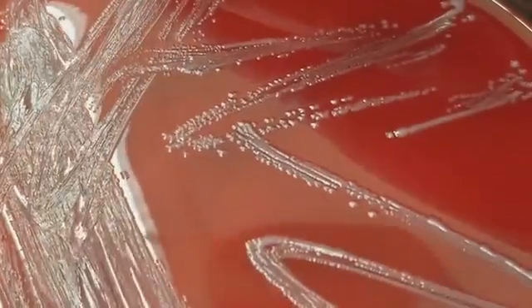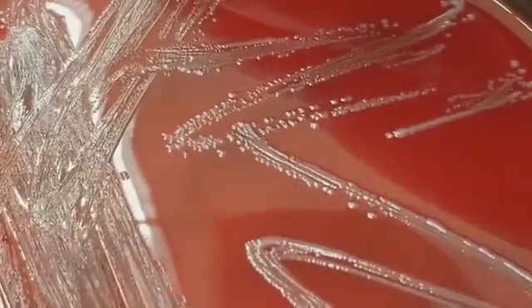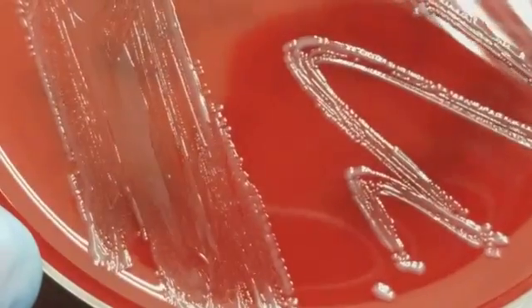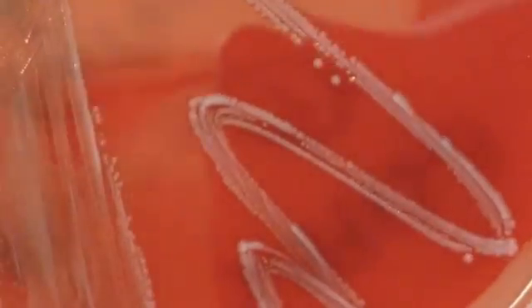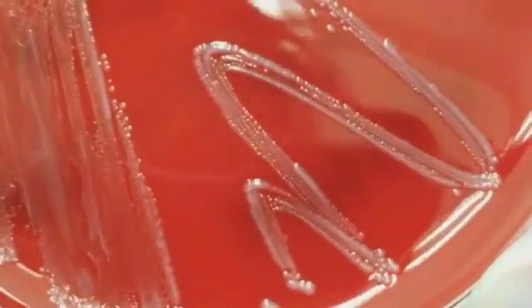So this is Enterococcus faecalis, okay, and this is from the gastrointestinal tract, as we just said. But notice it does look different from the staph that we saw on that other culture. It is kind of grayish or lacking in color, depending on where exactly you look.